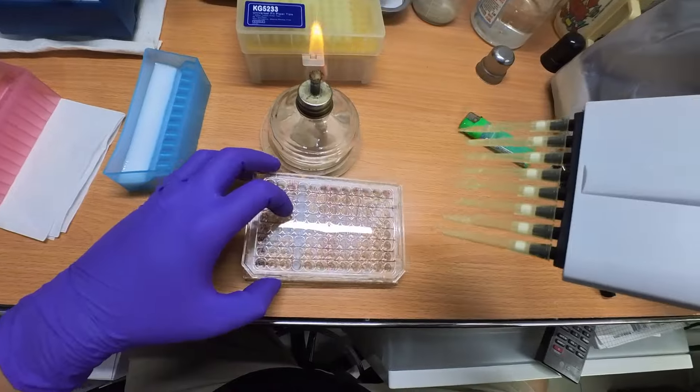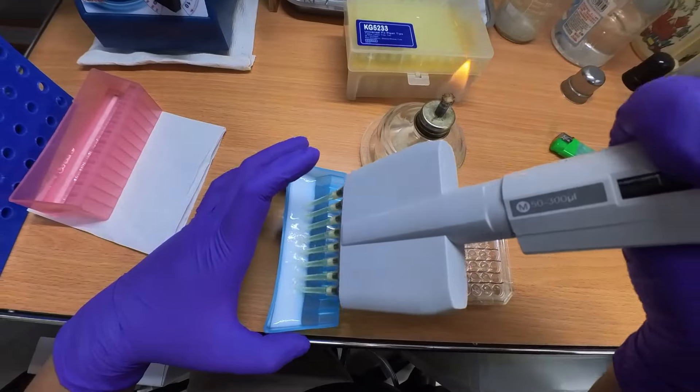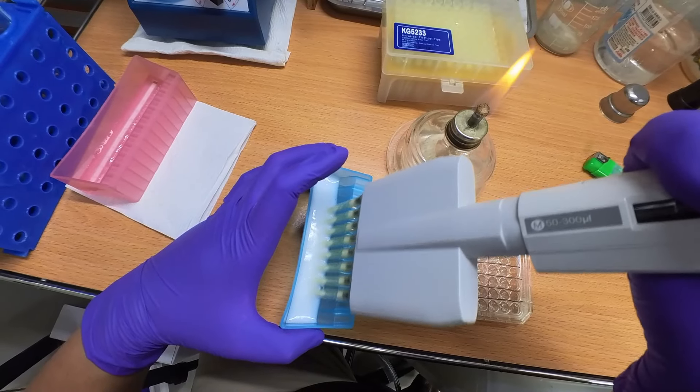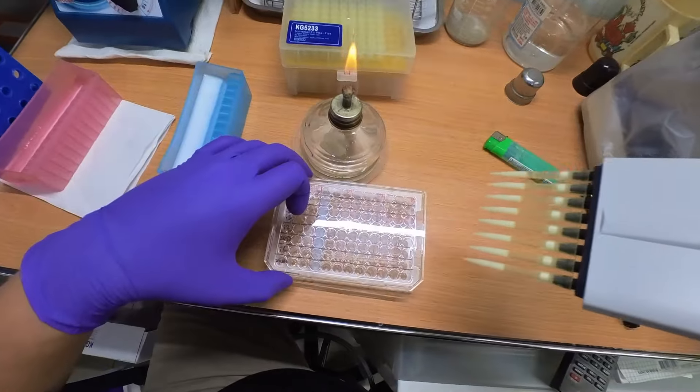Now the testing, the bacteria used in the testing and the method of testing is the same as what I did on the normal soap.